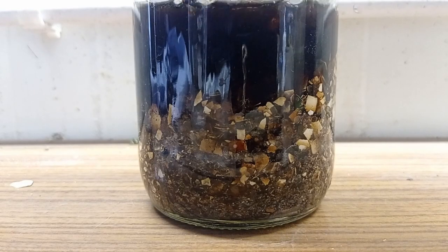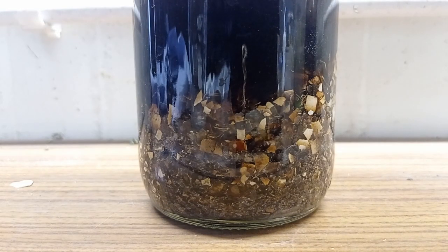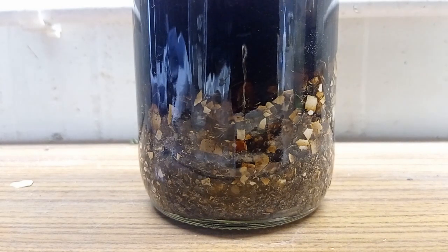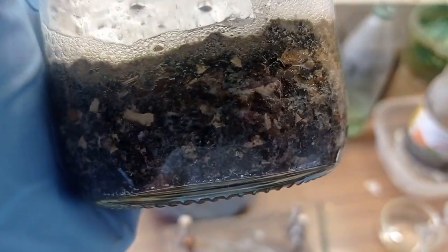So here's the reaction container. I added all of my acid and left it overnight, only to find out that I have too little water and calcium acetate precipitated out.